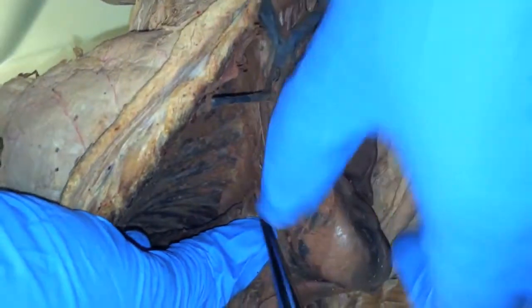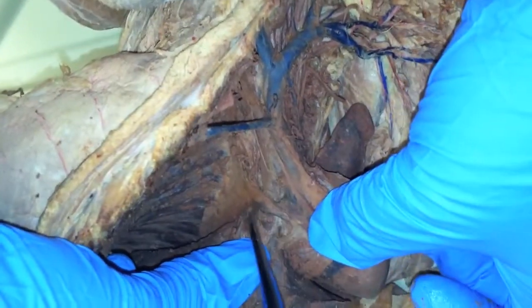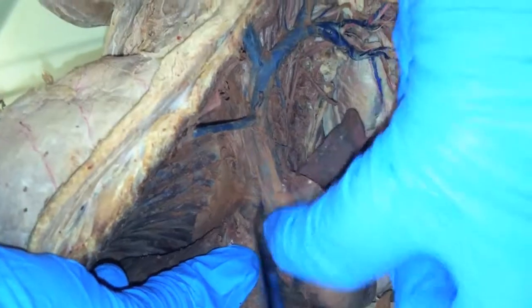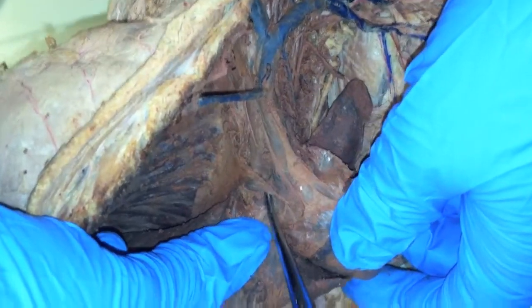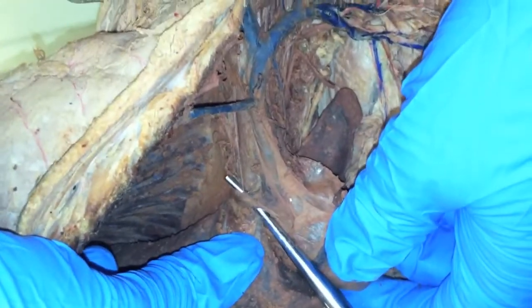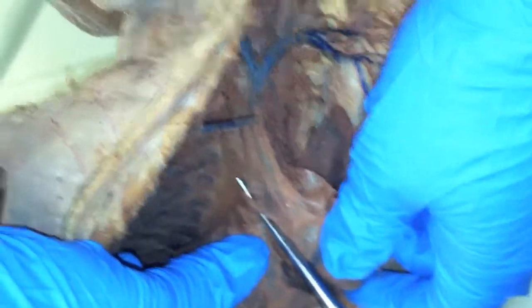Here, it's right there. See the blue coming in? So it's running into the anterior vena cava. There you see it. There she's got it. That's the azygous.